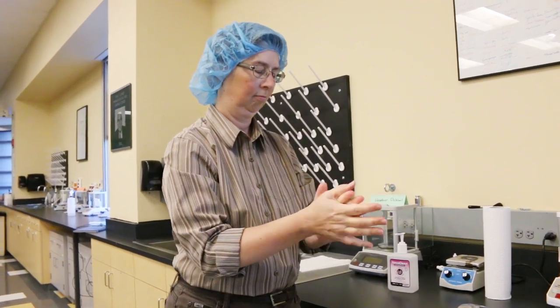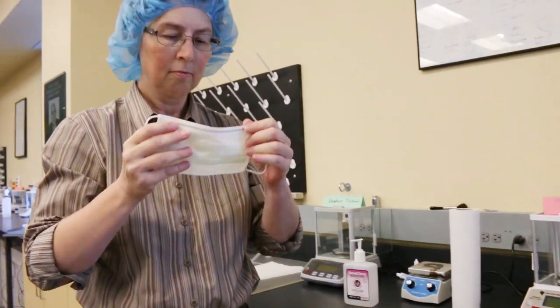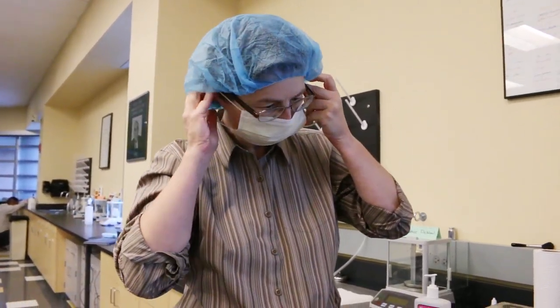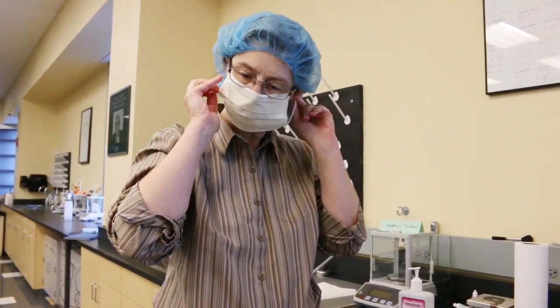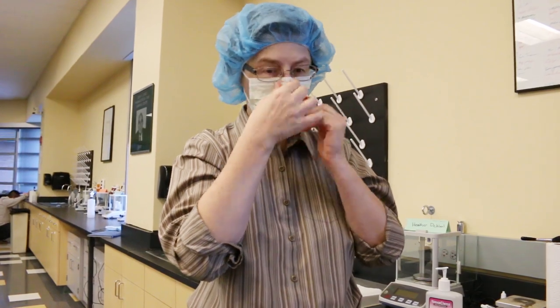Step 8 is to don a face mask by positioning the mask securely over your nose, mouth and chin. If you have facial hair, you must also don a beard cover and you need to supply that beard cover for the competition.